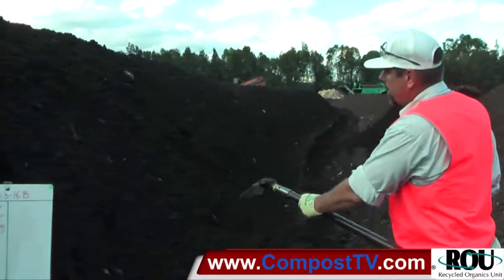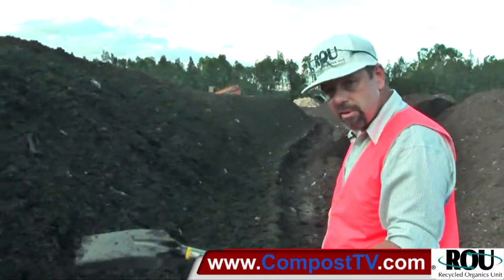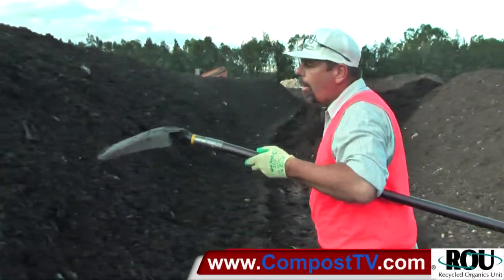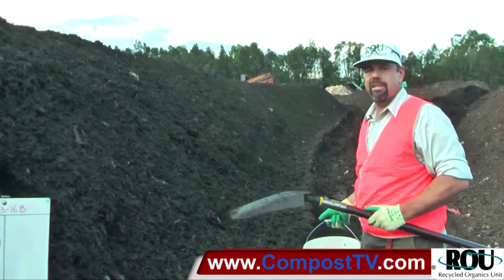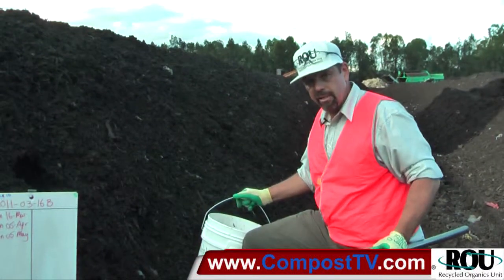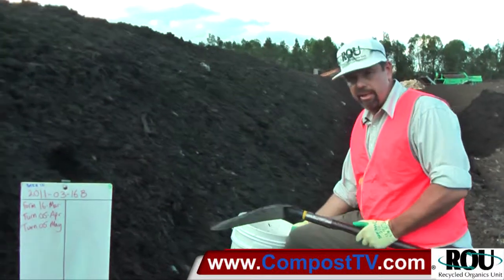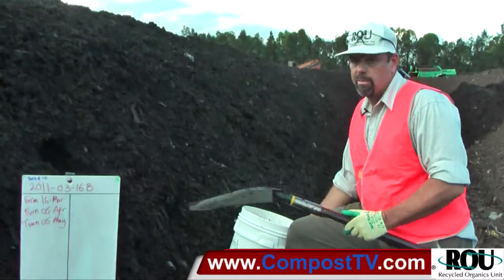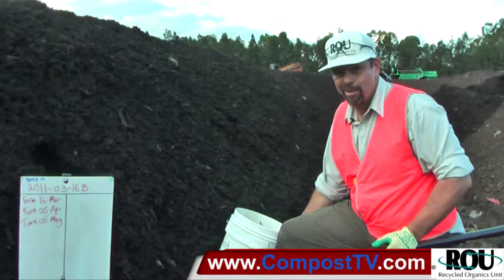Each sample I'll get within this accessible range. Remembering this has been thoroughly mixed, but we're not scraping off the surface — that'll be disproportionately dry or wet depending on ambient conditions. I'm digging in and taking a plug. All of those will be mixed together into a composite sample, and then I'll extract my representative sub-sample from that, which will be our sample for test. You need to make sure the sample you're sending off for test is representative of this pile, otherwise you're wasting your money, and you can't provide your customers with the advice they need about how to best use this material.